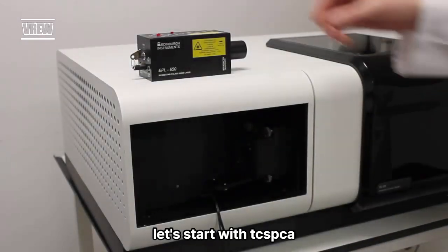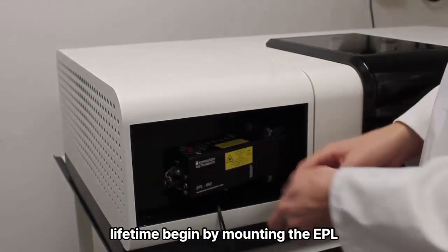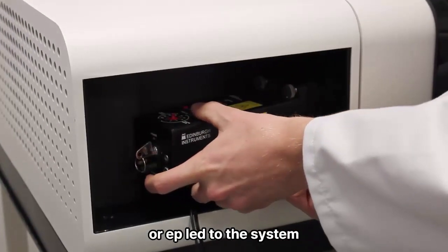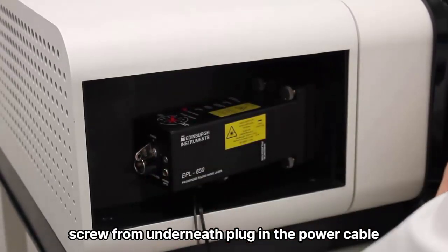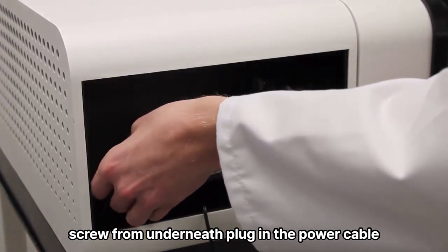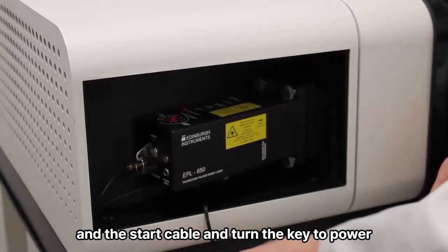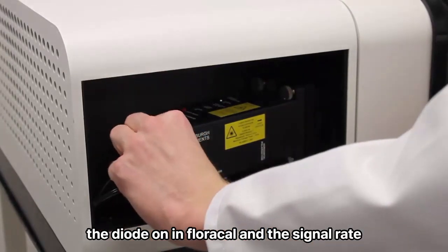Let's start with TCSPC lifetime. Begin by mounting the EPL or EP-LED onto the system. The diode slides into place and is secured by the thumb screw from underneath. Plug in the power cable and the start cable and turn the key to power the diode on.